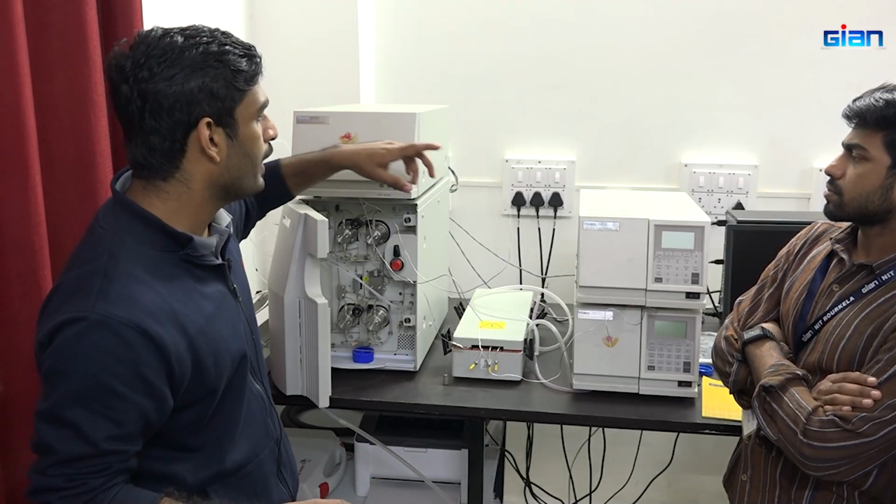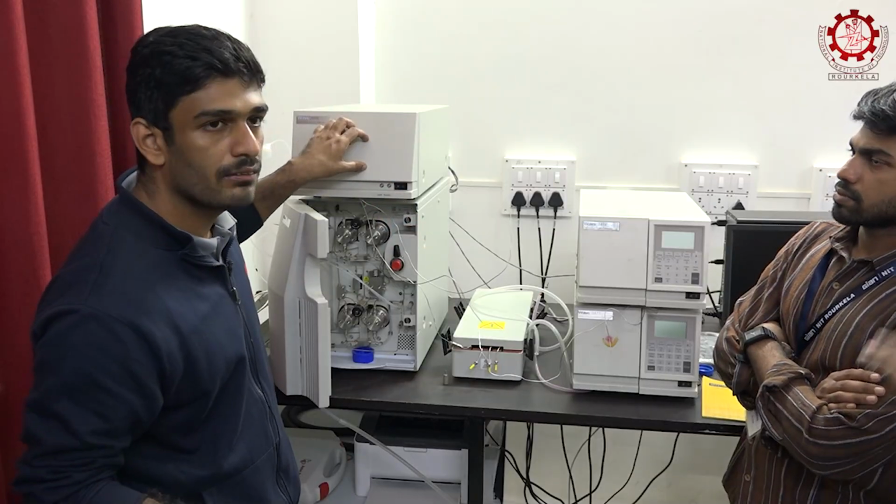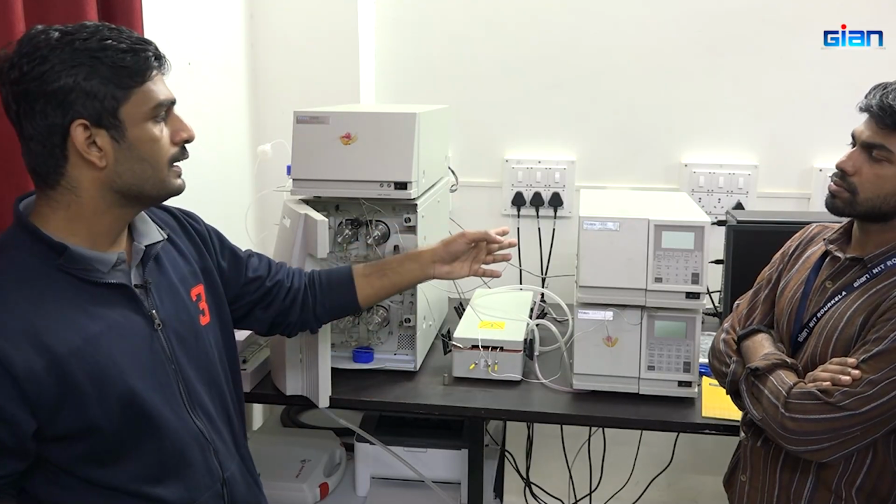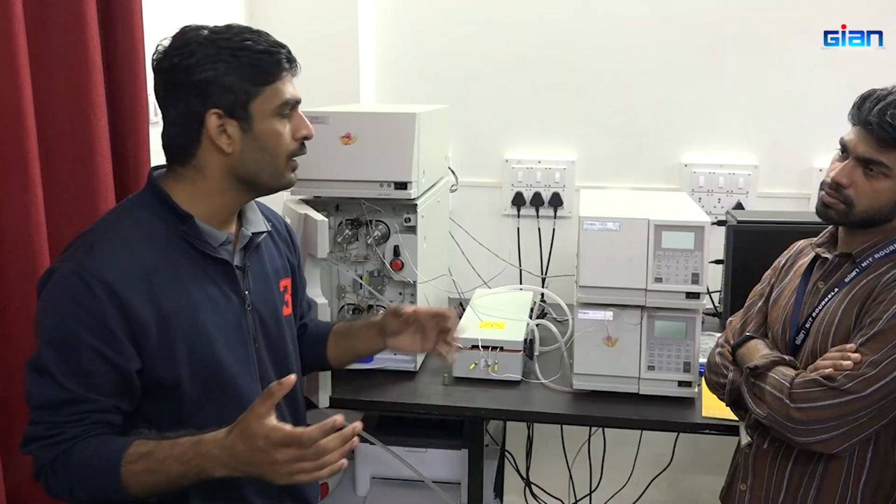The refractive index detector, like all these detectors, is a non-destructive detector. In the case of the flame ionization detector, you might have seen that it is a destructive detector, but this is non-destructive. The principle behind the refractive index is that we use a refractometer for detection of the TSS of the material. If it is sugar, different compounds will have a specific refractive index. Based on that, whenever light is refracted, we get an angle, like in spectroscopy. Based on the angle, we detect the particular compound. That's the principle behind it.